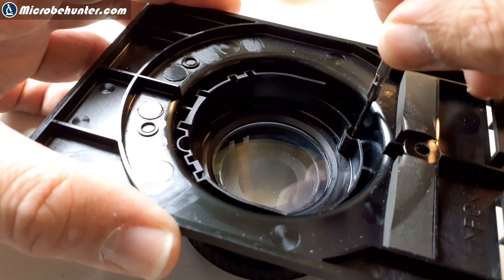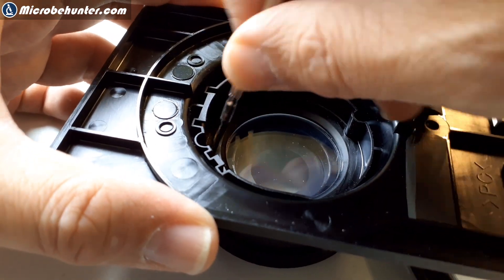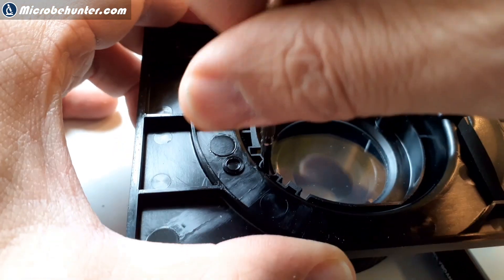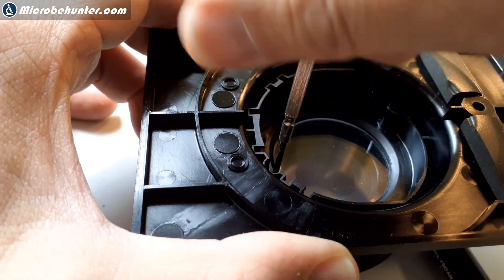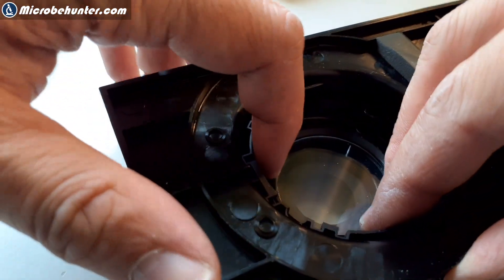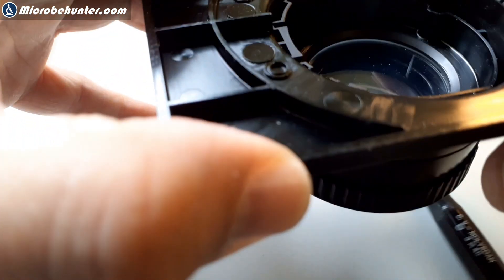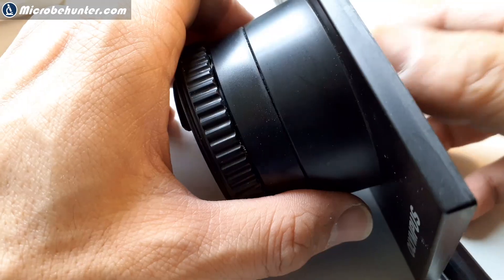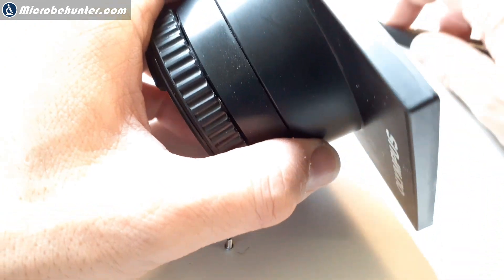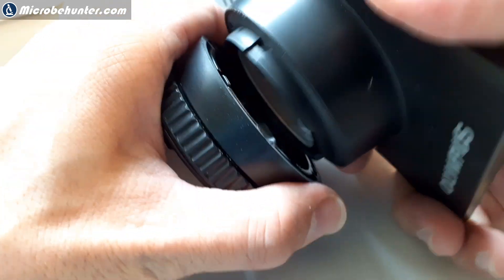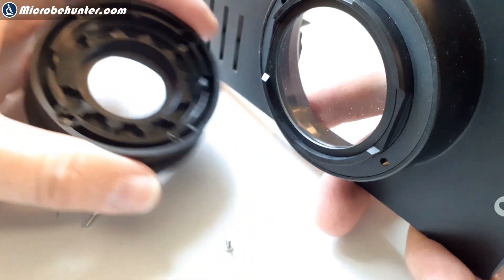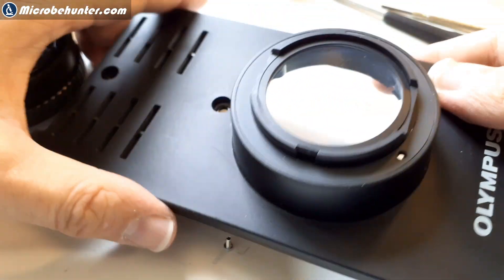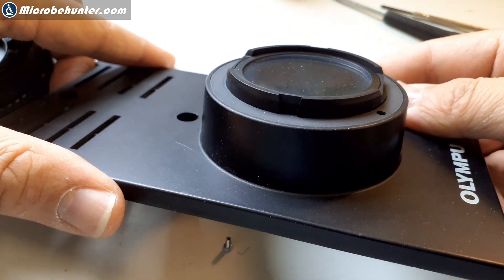When I removed everything here, maybe you can already start to see it, that there is already quite a bit of dirt also on the inside surface of the system here. So reaching all of these things was not so easy, but luckily it could be serviced. That was really important that all of the parts could be taken apart without any problems. You couldn't remove it from the inside. From the outside, it works.